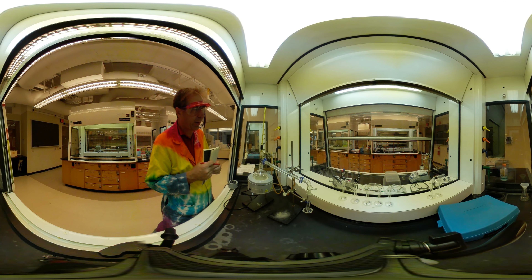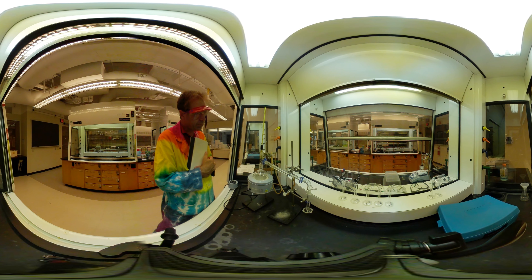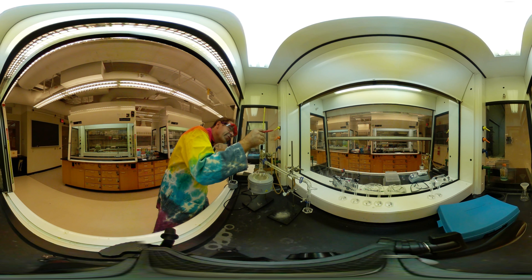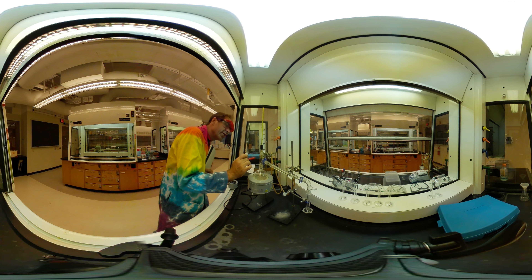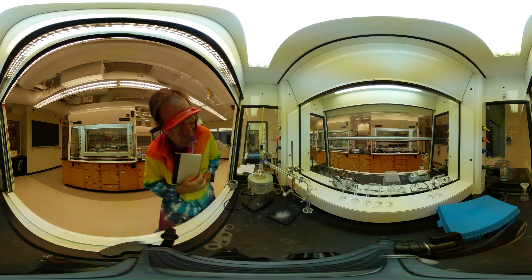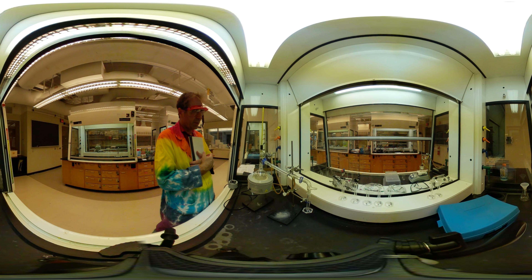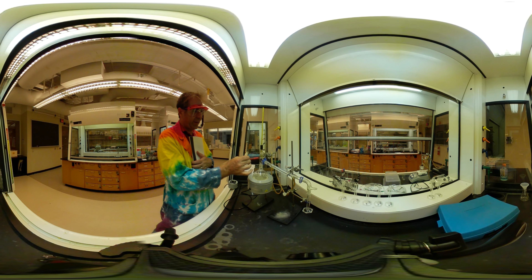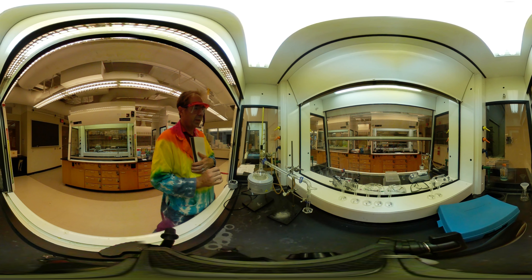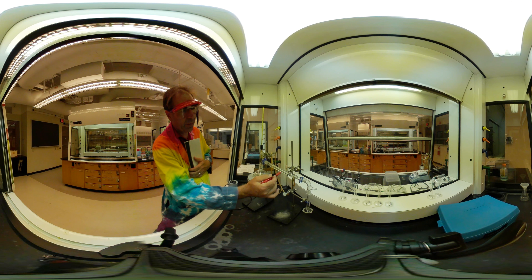I just saw something drip off my thermometer, so we should be very close. Got to be a little bit patient. Make sure we're centered in here — it's a little lower than the point at which it goes across, so it's going to hit that first. You can see it now starting to condense in this space up here, and my temperature is definitely still rising. I've got a drip coming through right there.